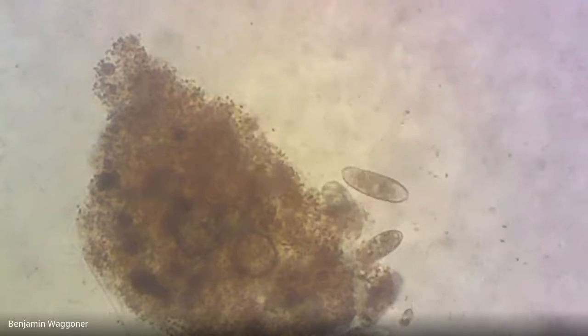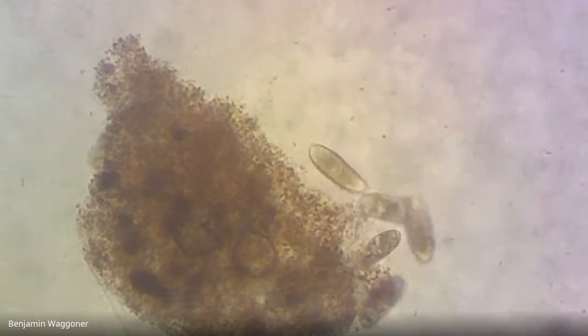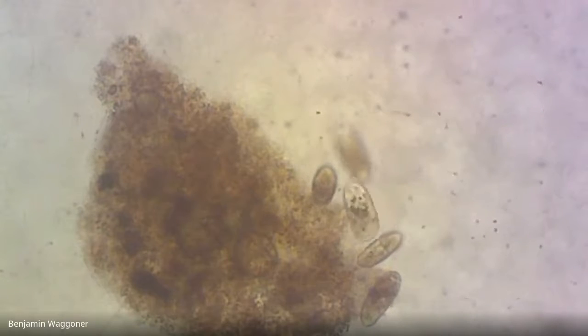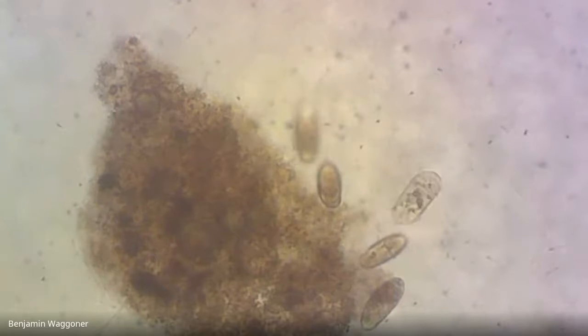If I could get him to slow down a little bit, he almost looks like he might have specialized cilia on one end. It's getting hard enough. I think I can see, unless it's the after effects of quitting crystal meth yesterday.